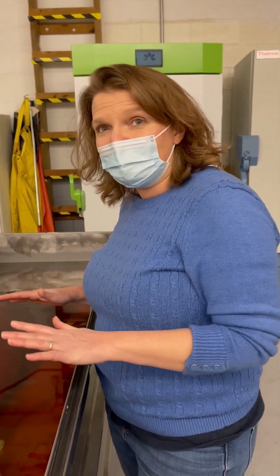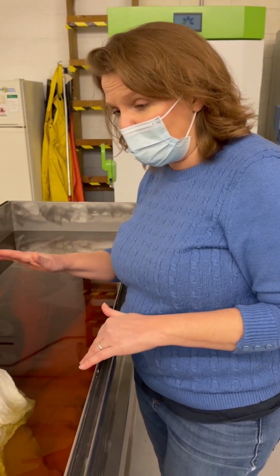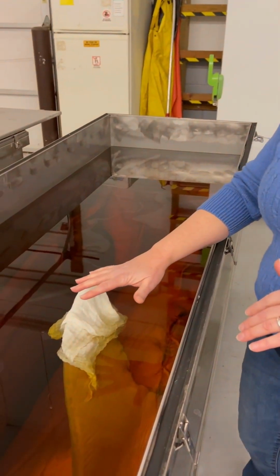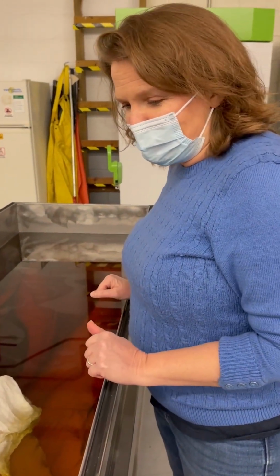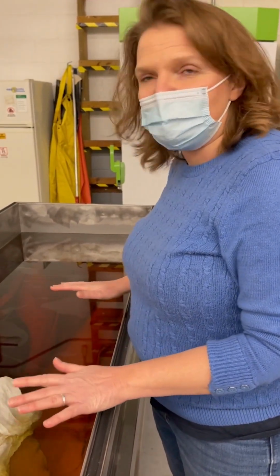You also get pigment that leaches out. And so when we put the ethanol in here originally, it was crystal clear, but that was maybe 5 years ago, and now it is this dark color.